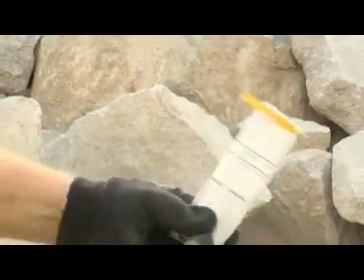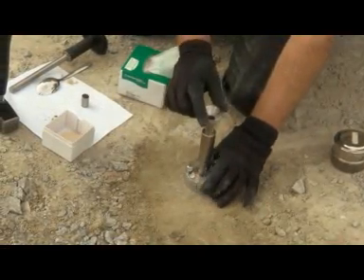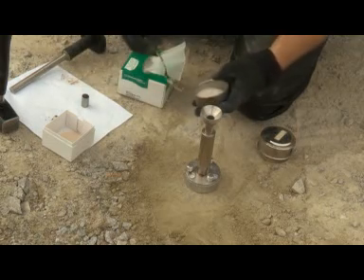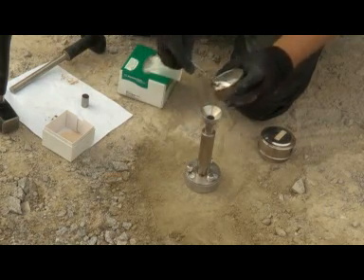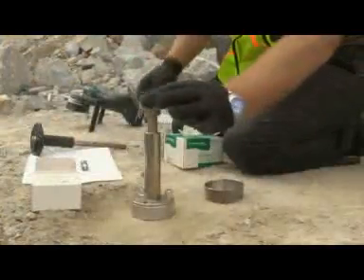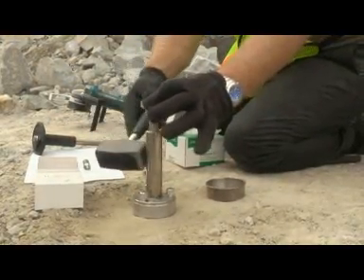With this material, you may now generate a pressed pellet. Now we are ready to press a pellet. Assemble the press as outlined in the user's manual and feed the sieved sample directly to the pellet press. Transfer approximately one full tablespoon from the sieve base to the pellet press. Gently tap the side of the pellet press with the hammer to move the powder to the base of the press.